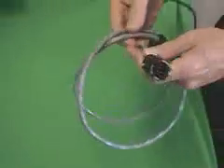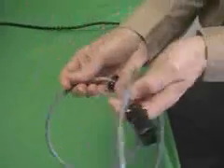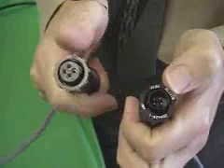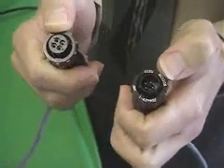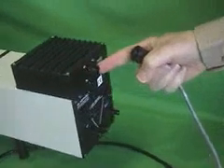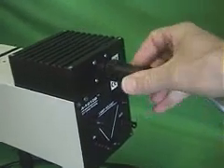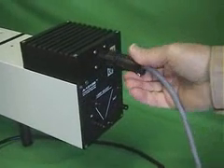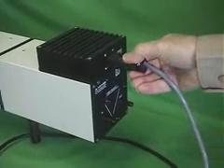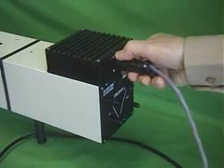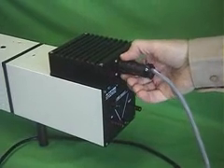Another cable comes bundled up. Just unwind it like that. Notice that there are two ends, one male end and one a female end. The female end of the cable connects to the male end on the igniter. Just rotate it until you feel that it pops in. Then you can turn the black plastic connector on the front and it secures it in place.